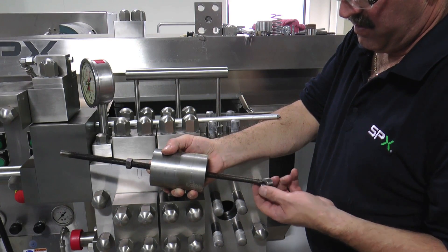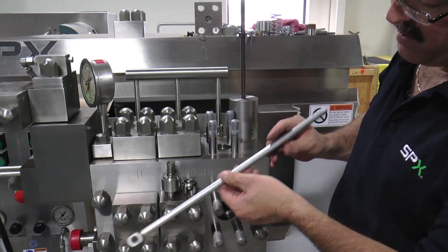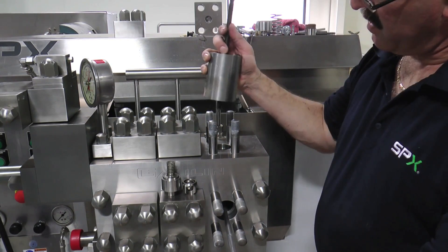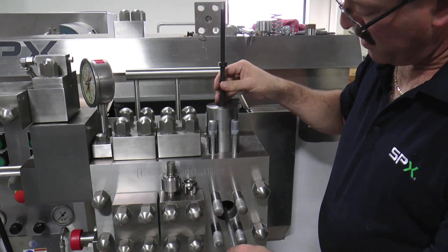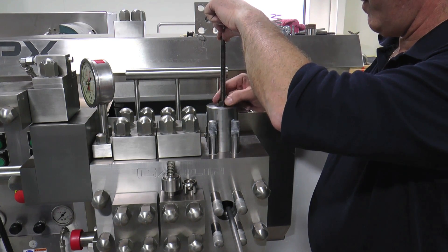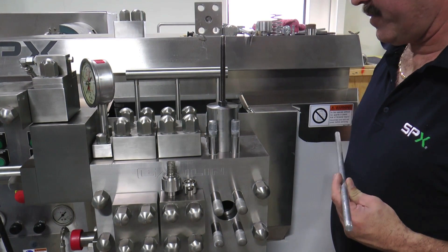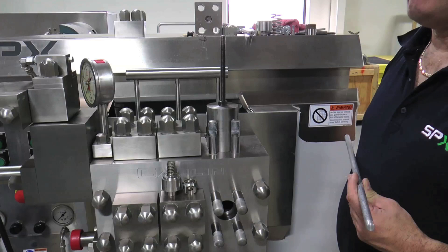Remove the nut on the bottom of the puller. Use the aluminum extension rod to secure and position the nut in line with the plunger below the seat in the plunger bore. Place the puller cylinder in the area between the studs and tighten the puller shaft into the nut held with the aluminum extension rod. Once the puller has been aligned and tightened down to the spacer block, the extension rod can be unscrewed and removed. Use a wrench to turn the nut on the puller to remove the seat from the bore. Ensure the puller has a good grip on the seat and maintain solid footing, as it may quickly release from the bore. Do not remove the seat unless you plan on replacing it.